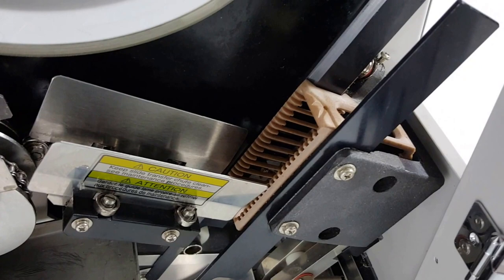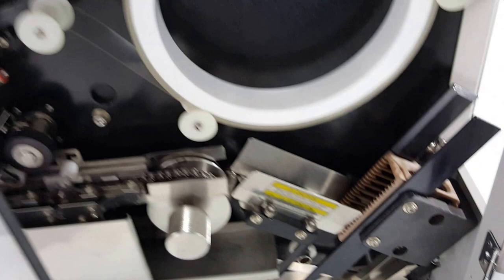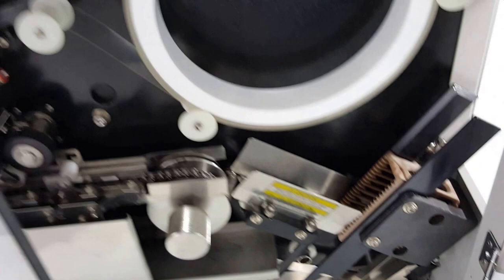There is a receiving basket on this end that will catch the slides after they are cover slipped. The 'upside' marking is also on the top of that basket as well. I'm going to shut these doors and we are going to run this.